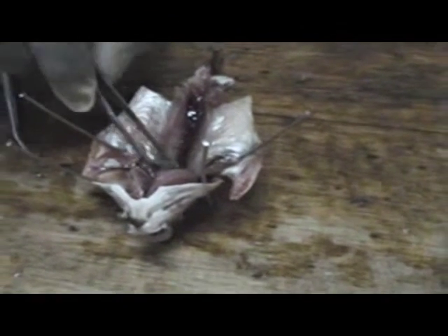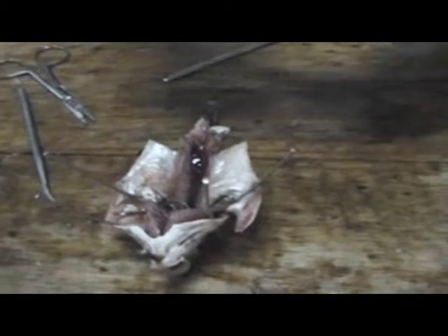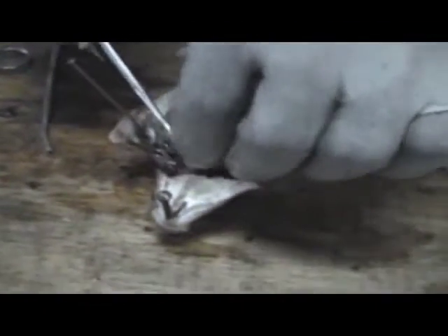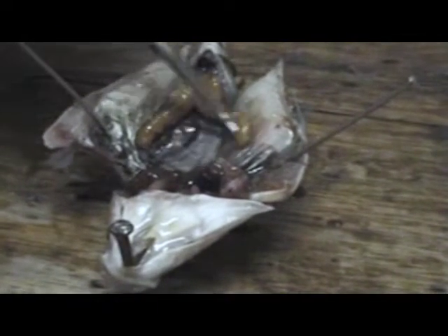What we are going to look at now is the genital system — that's the reproductive system. We are going to use this other fish, which I said was a female, to see where the reproductive systems are located. We will remove the intestines to observe the genital parts — that's the urinogenital system. What we are left with here now — these ones are the ovaries, these two like this, bearing so many eggs.